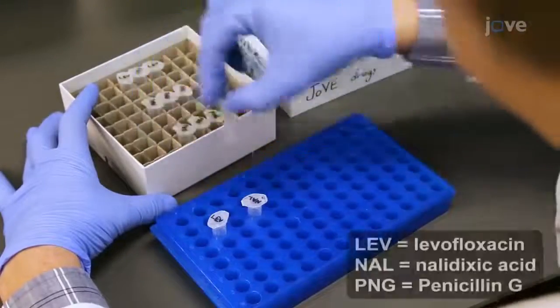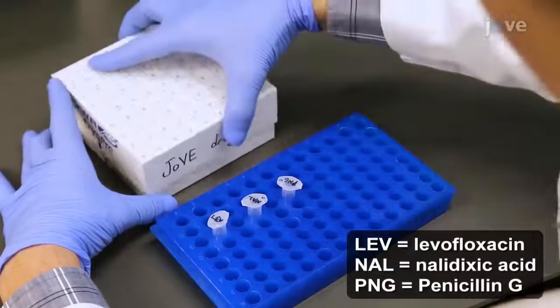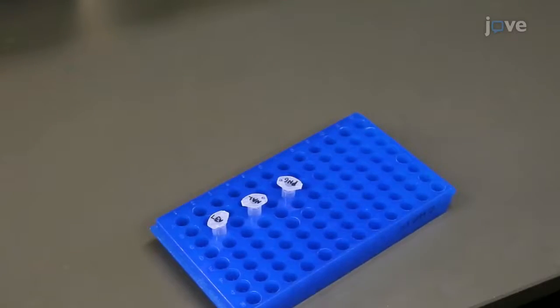Take one aliquot of each drug from minus 20 degrees Celsius and leave the aliquots to thaw at room temperature for 10 minutes.